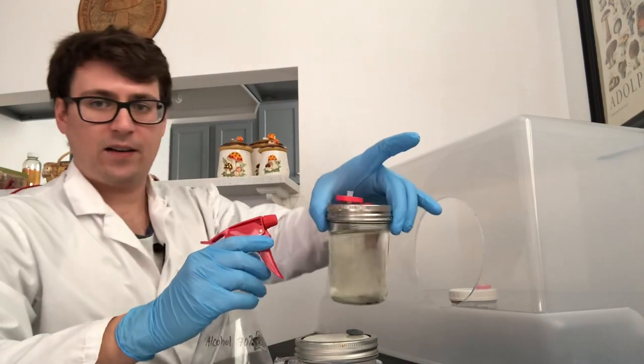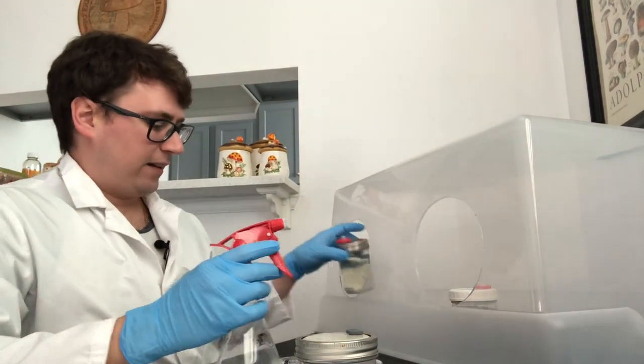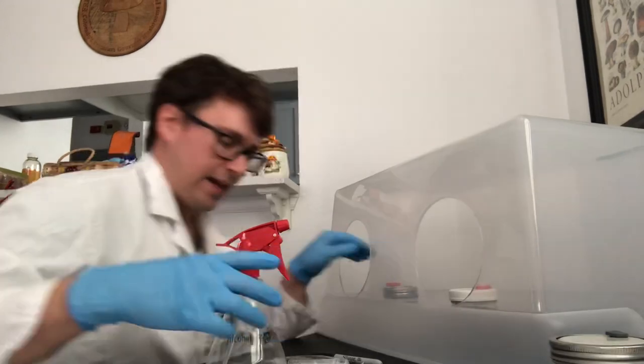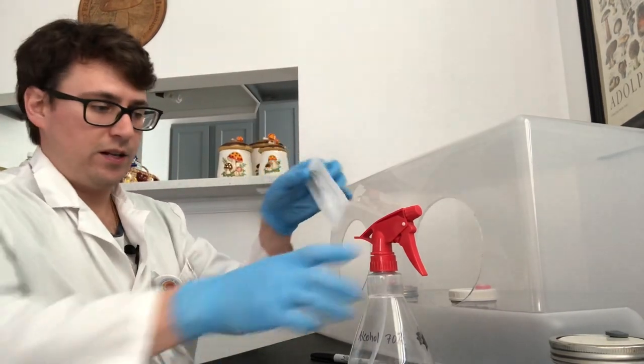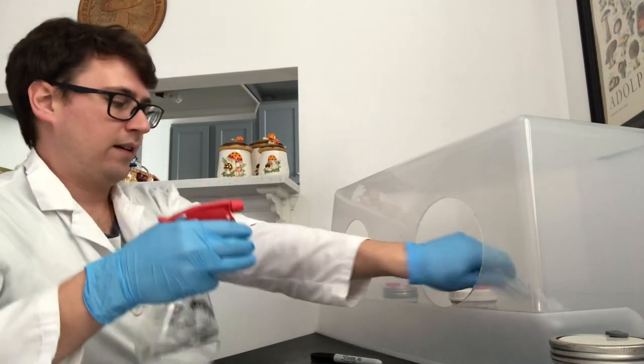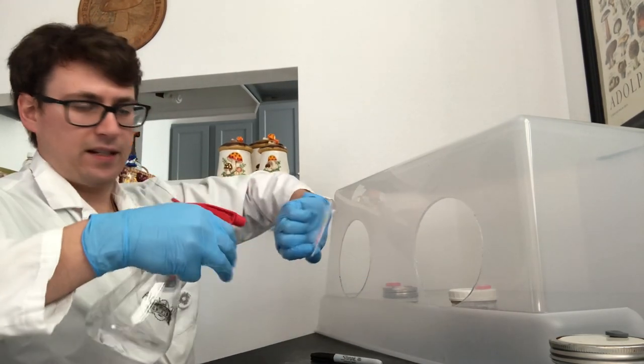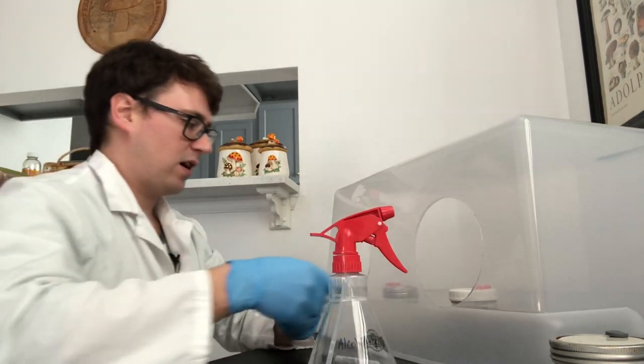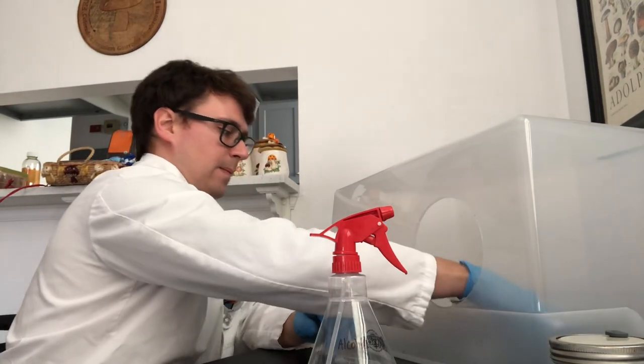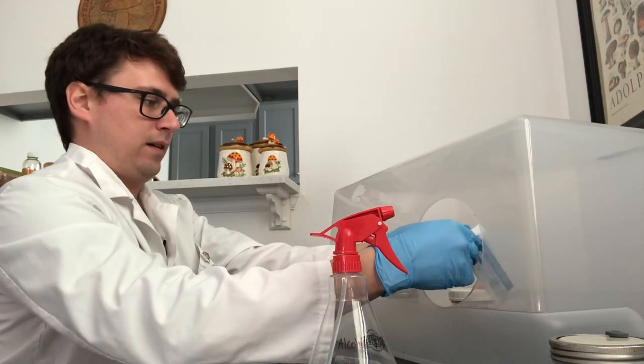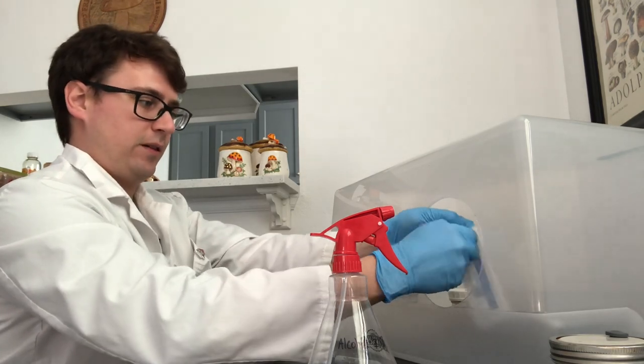I'll go ahead and just sterilize the top of that liquid culture and then I've just got a sterile syringe here, so spray this off, and a 16 gauge needle to draw my liquid culture. Then I'm just going to open up my syringe.